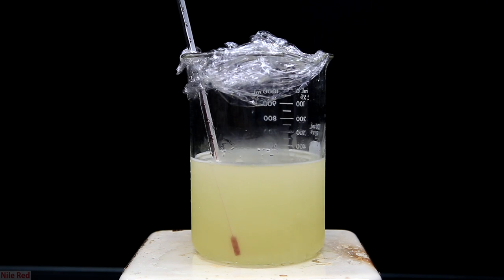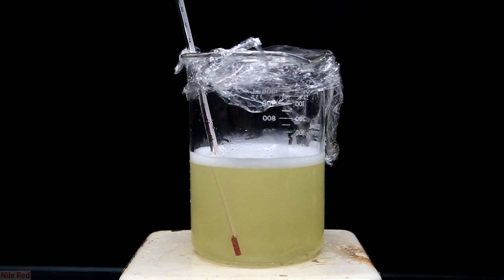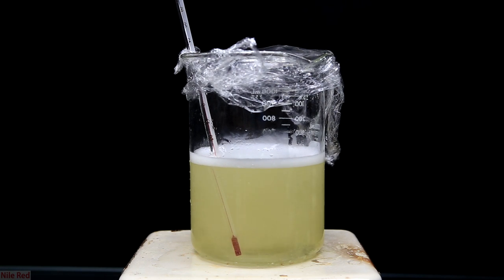Hydrazine sulfate, on the other hand, is a powder instead of a liquid, so it doesn't have the volatility issue. It's also not explosive and it's not nearly as toxic. All of these factors together make it much safer to work with, especially if it's going to be something that's done at home. Hydrazine sulfate is capable of doing all of the same reactions as freebase hydrazine — the hydrazine sulfate is added to a reaction and the freebase is liberated in the reaction itself. This technique allows us to avoid handling pure hydrazine.